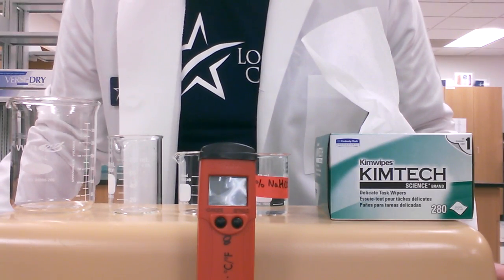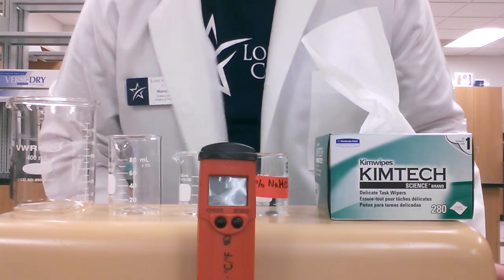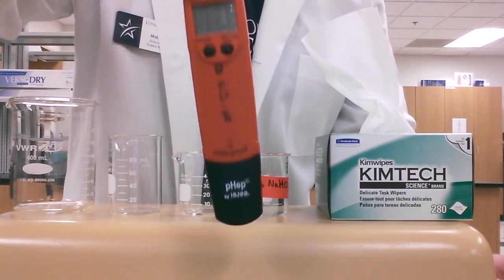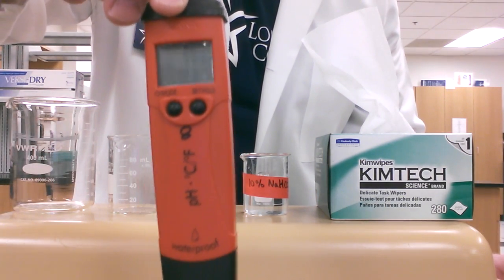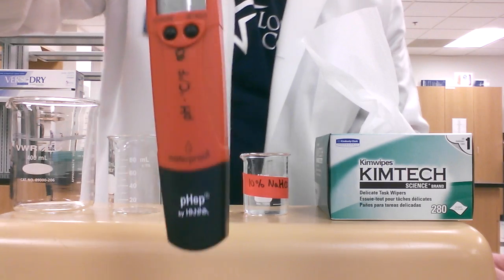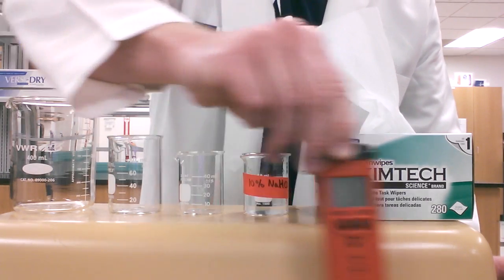Okay, we're going to do a short review of how we use the new pH meter. This is a new handheld pH meter, really easy to use.